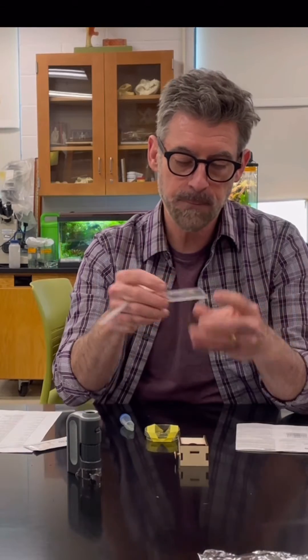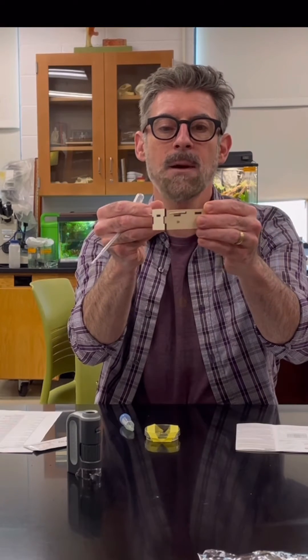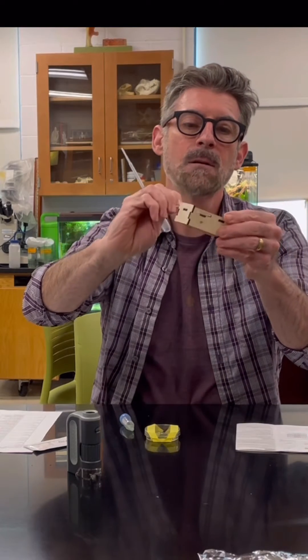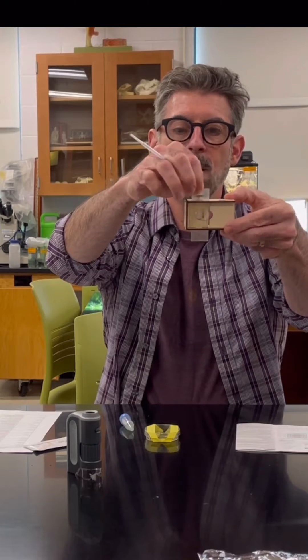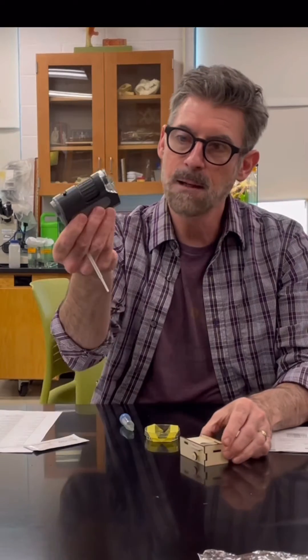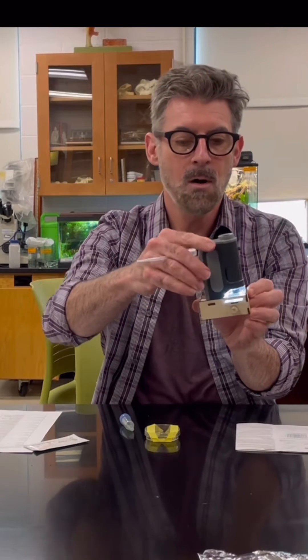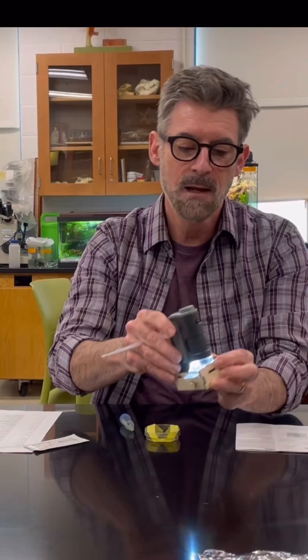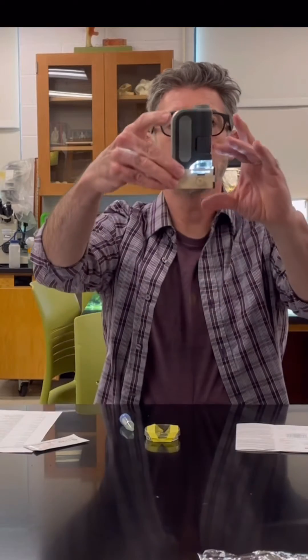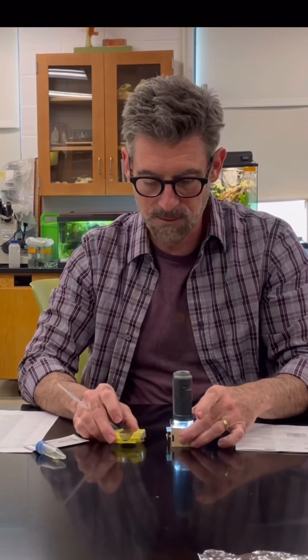On the little stage there are cutouts on the side and the slide pops in there - it fits right through. It's not locked in place; there's a little wiggle room, but not too much. It's pretty much going to keep the grid lined up with the scope. When you take the scope and put it on to the stage, it also has a small amount of movement, but if you push it all the way forward and pull it back slightly you'll almost directly line up with the slide and grid.